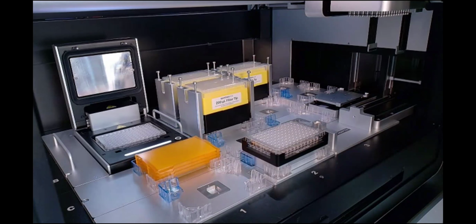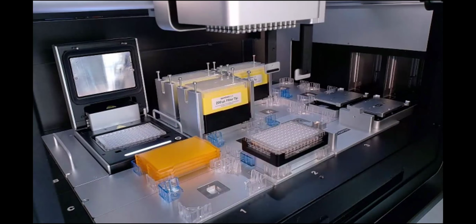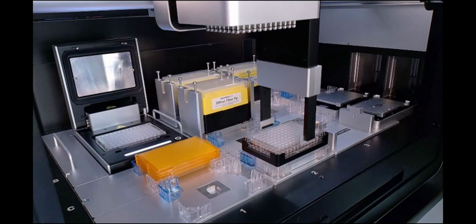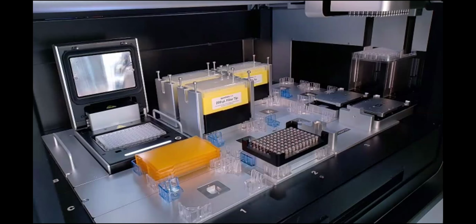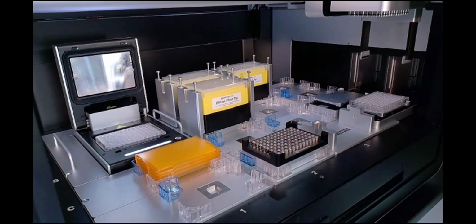Our PCR auto sealing lids have been tested to ranges that actually exceed what the thermocycler temperature and also the heated lid are able to reach here. And we have data supporting what are the evaporation rates and the yields shown with our Opentrons tough PCR plates and the Opentrons tough auto sealing lids.